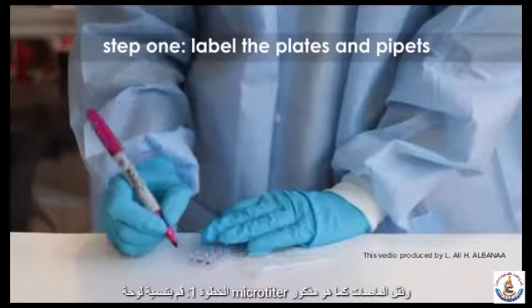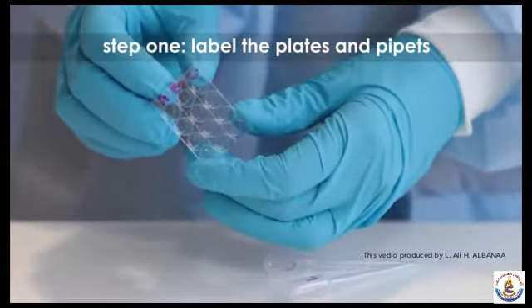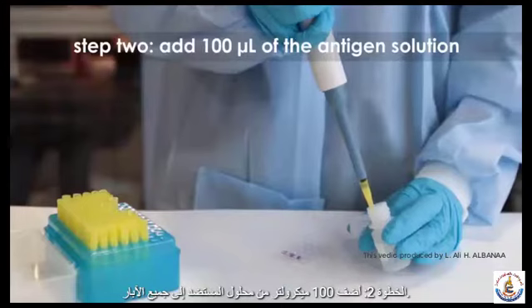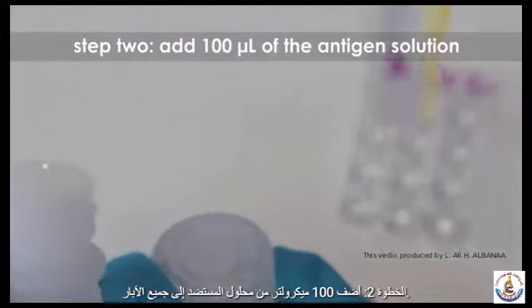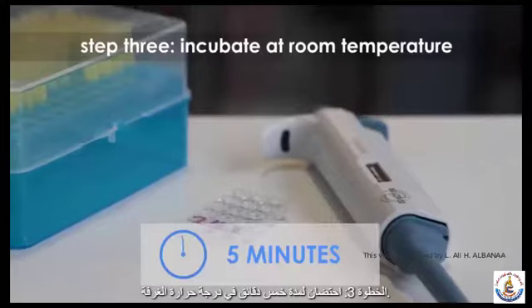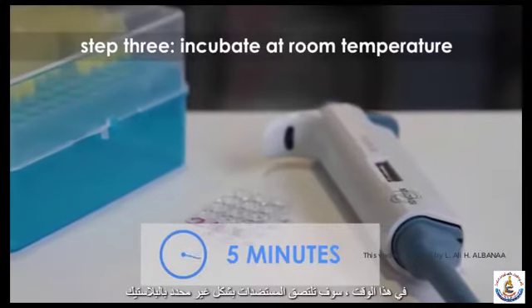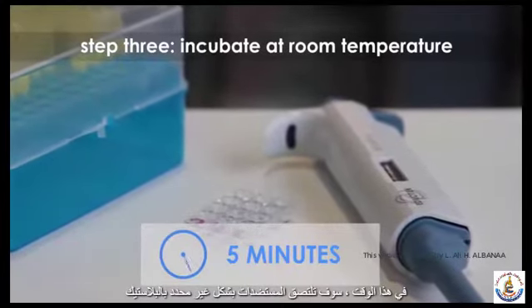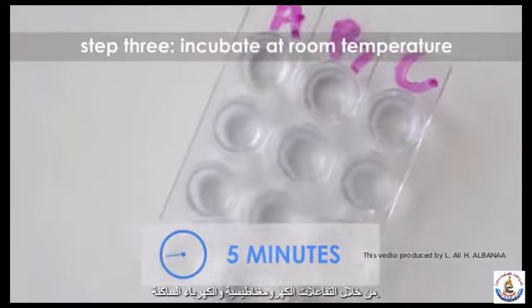Step 1. Label the microtiter plate and transfer pipettes as noted in the product literature. Step 2. Add 100 microliters of the antigen solution to all of the wells. Step 3. Incubate for 5 minutes at room temperature. At this time, the antigens will non-specifically adhere to the plastic through hydrophobic and electrostatic interactions.